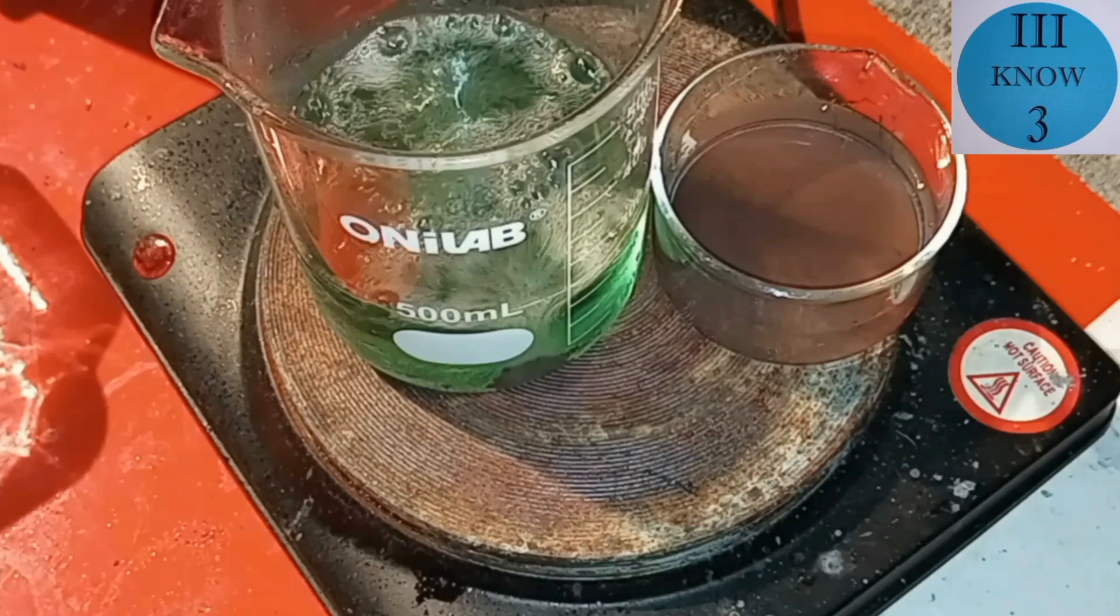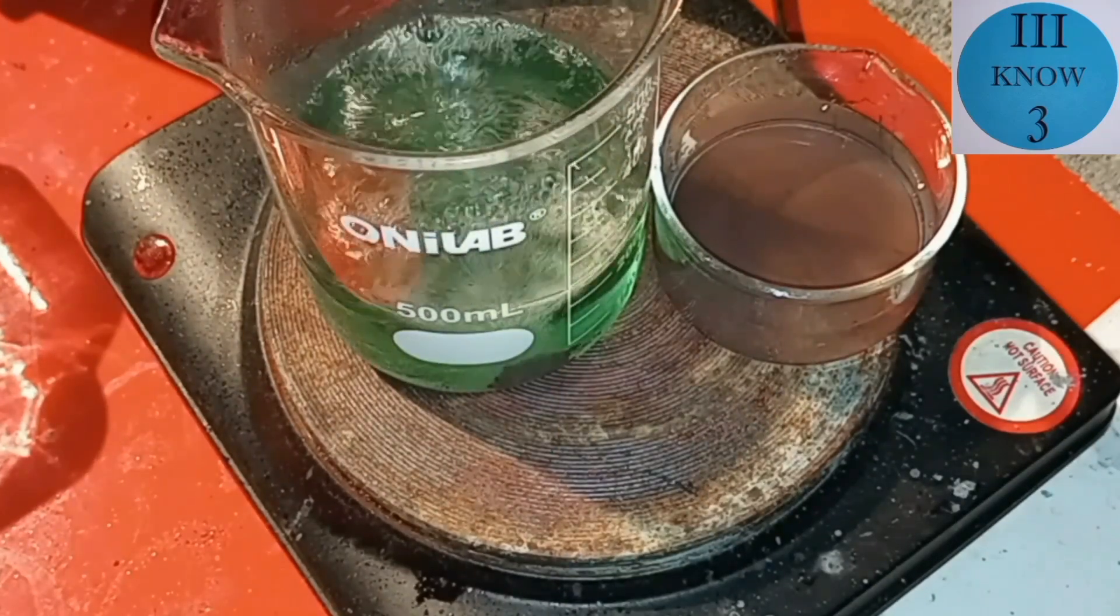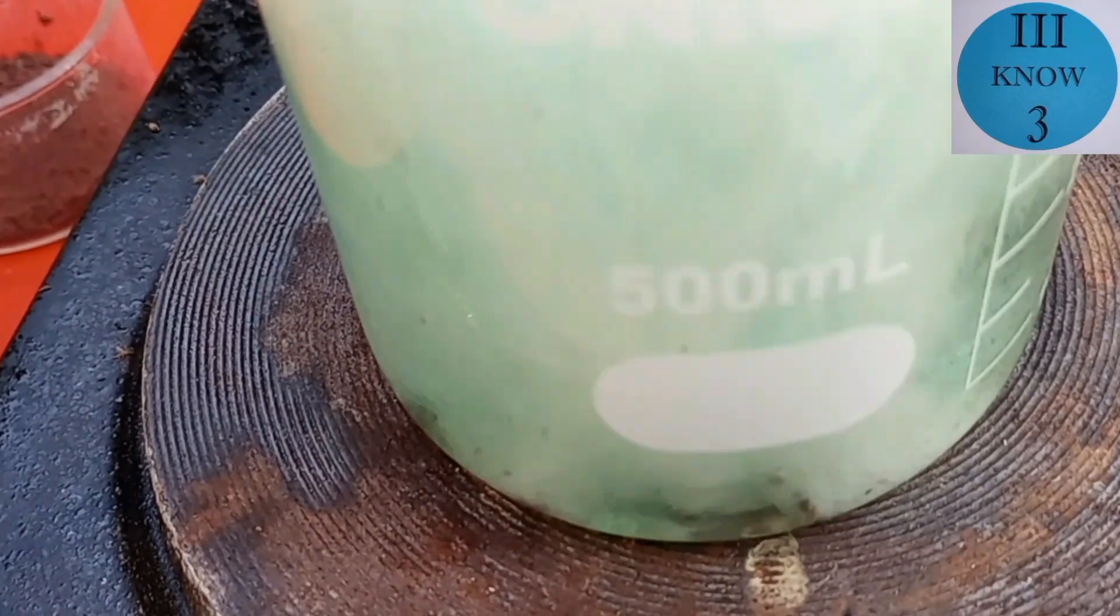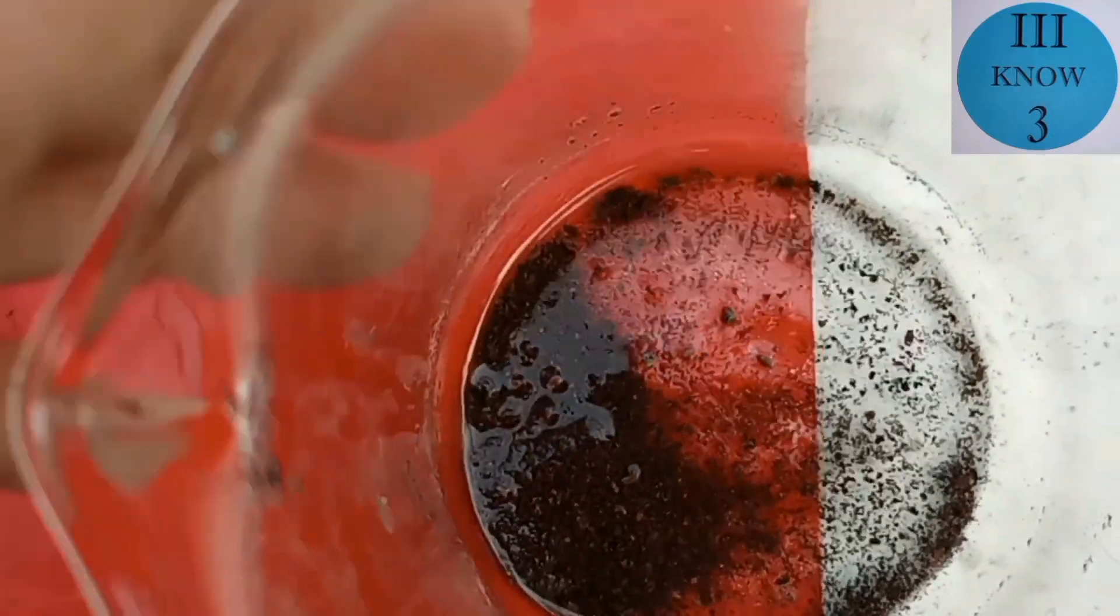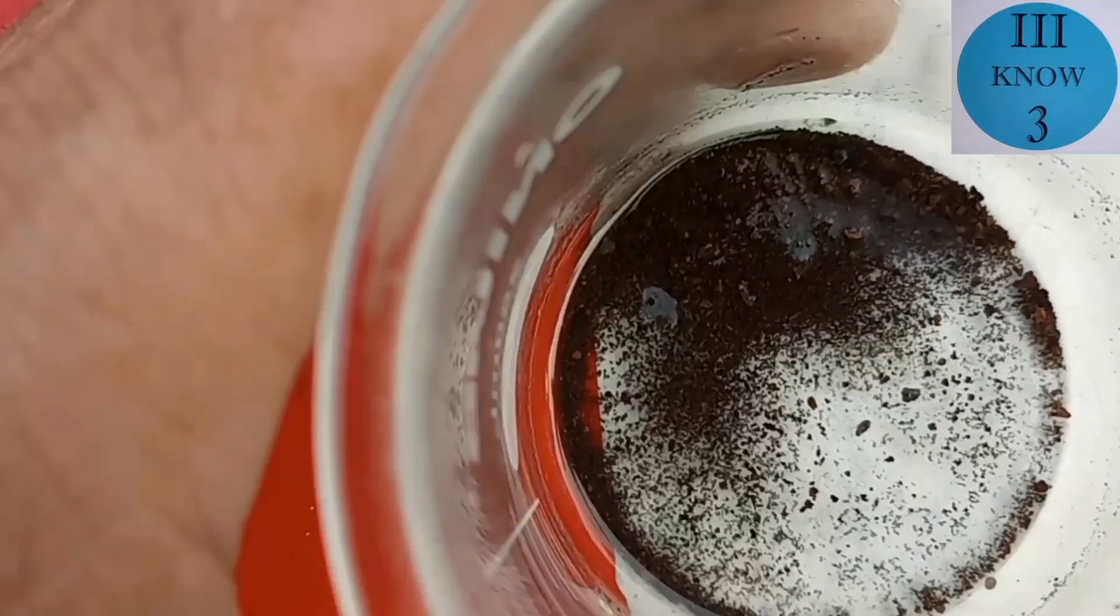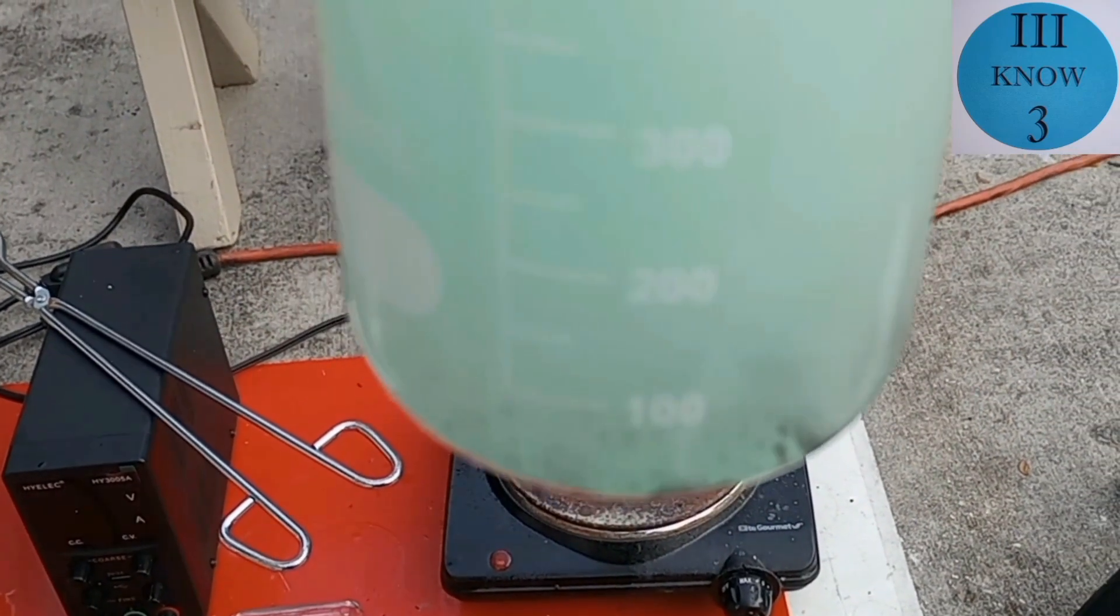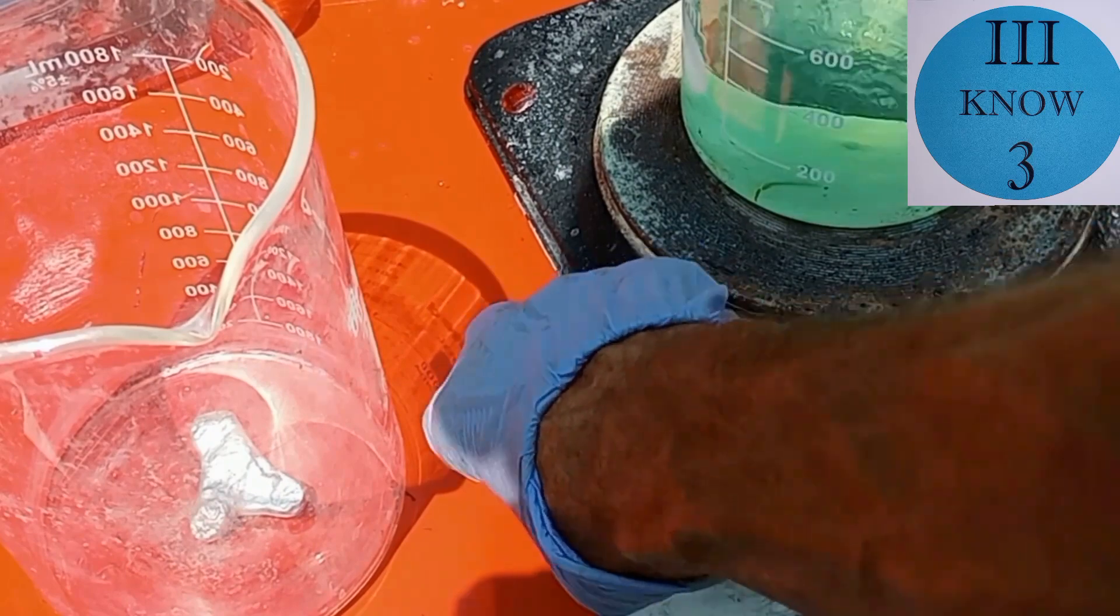I didn't film it but I removed all the precipitant that looked like copper. It really reminds me of what happened with my electroplating experiments that led to this project with the nickel and the copper plating out together. Here you can see that the zinc is displacing what looks like pure nickel and I was able to decant off the liquid and get some out at this point.